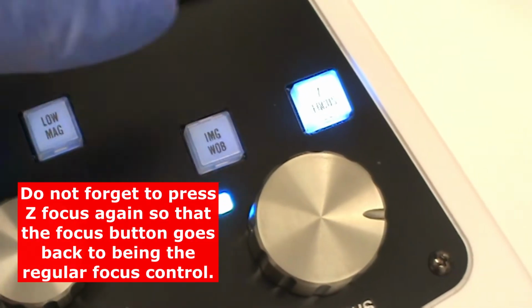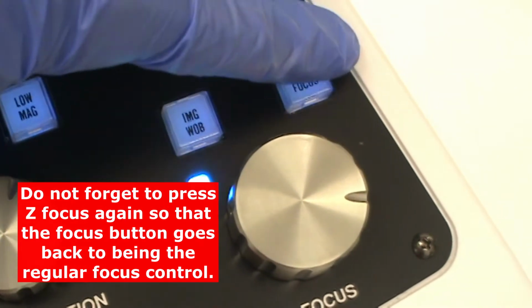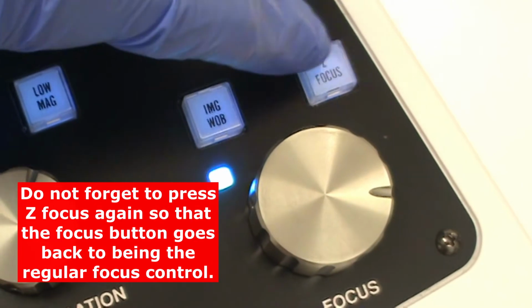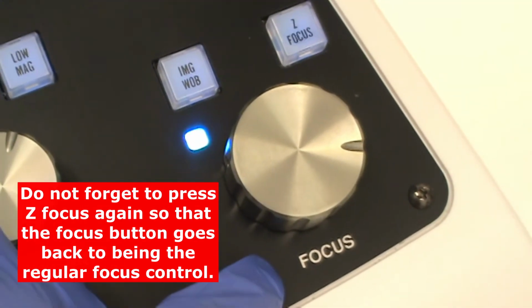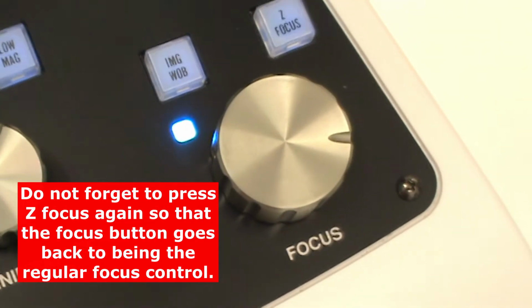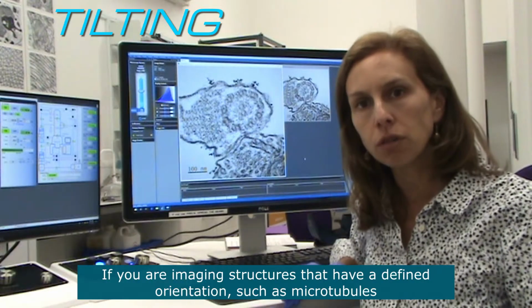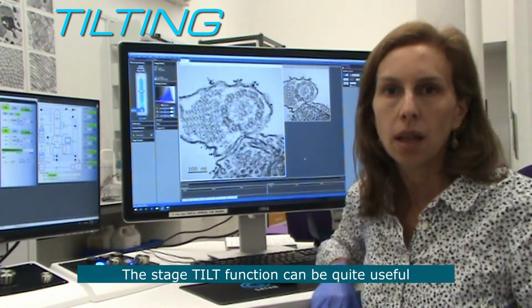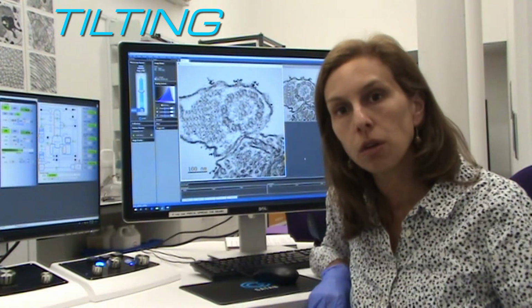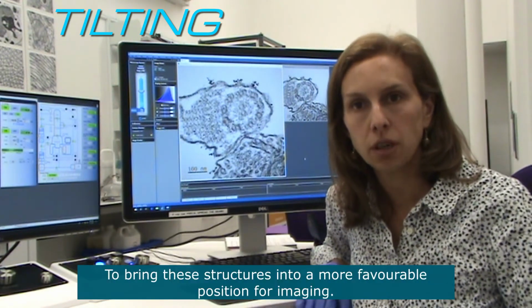Now do not forget to press Z-focus again so that this function is not lit up anymore. And now the focus button has gone back to being just the normal focus. If you're imaging structures that have a defined orientation, such as microtubules, the stage tilt function can be quite useful to bring these structures into a more favorable position for imaging.